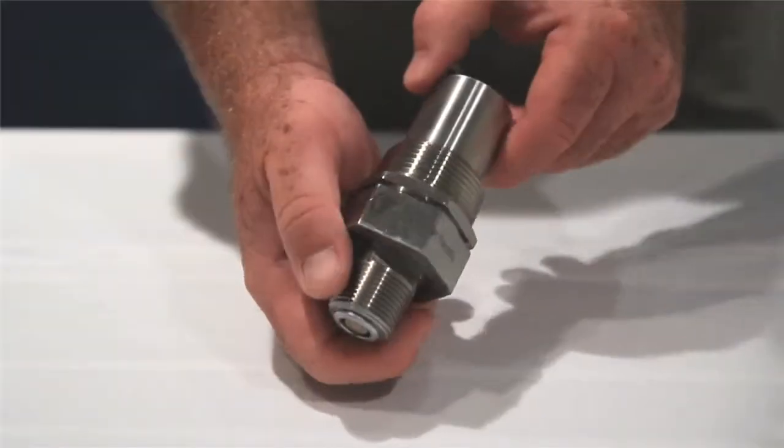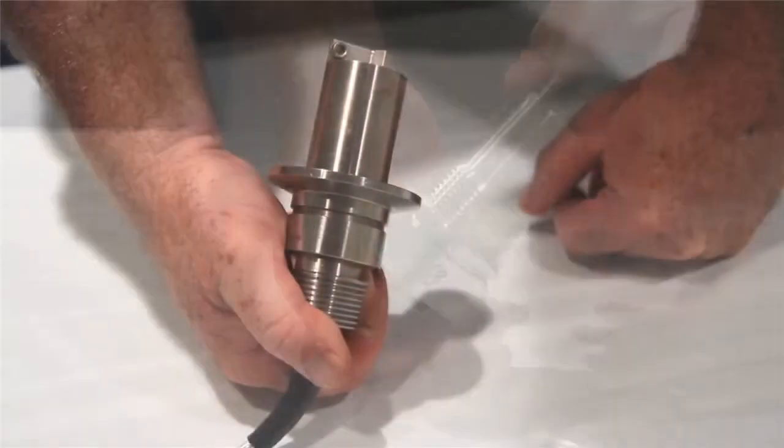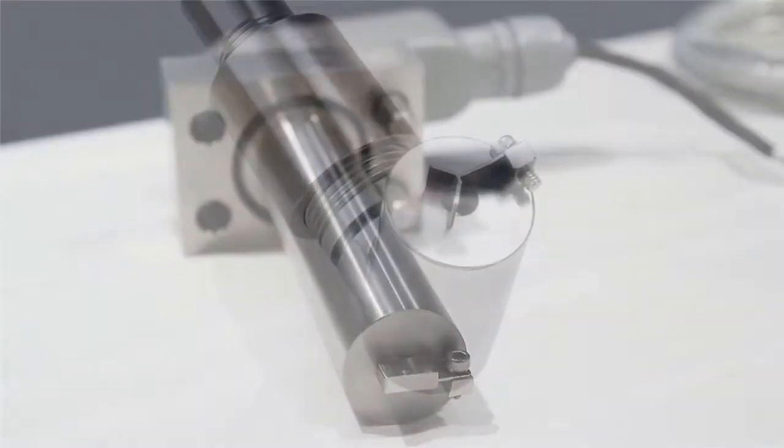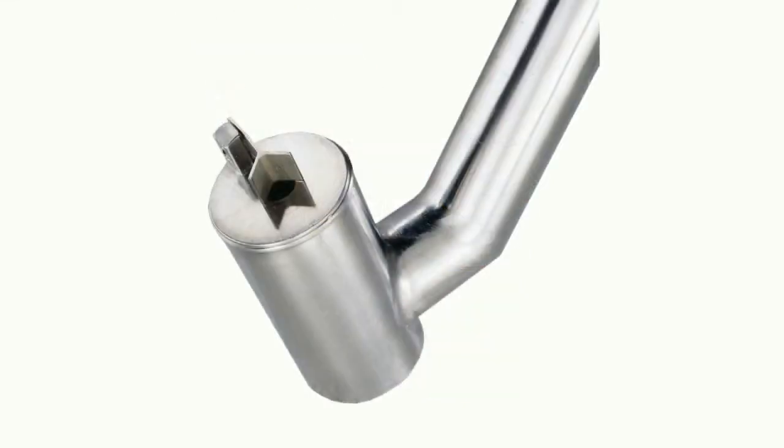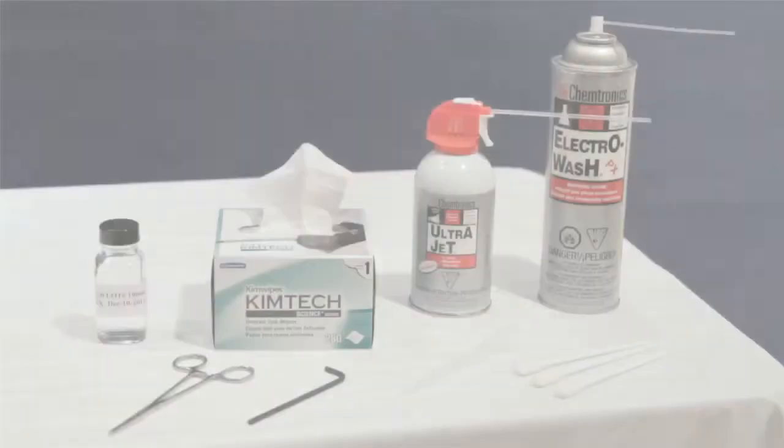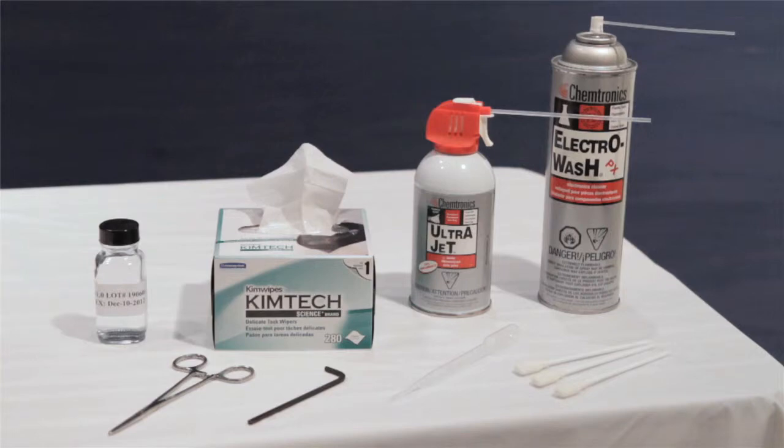The following video will show a user how to clean a 300 series Cambridge Viscometer sensor. You will need the following supplies to clean the sensor.